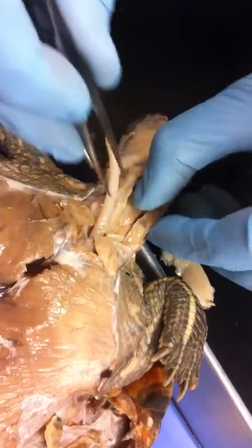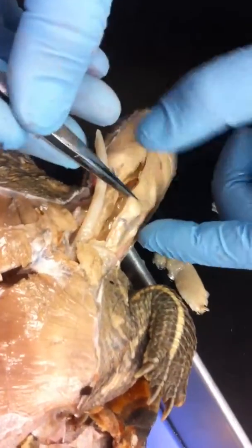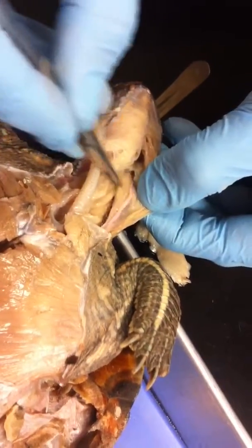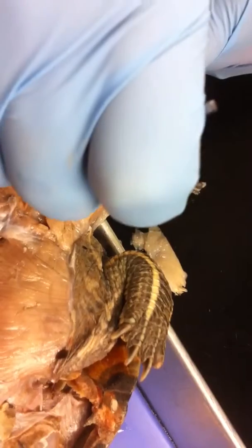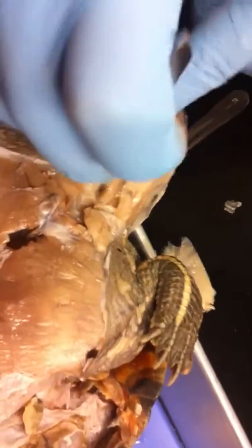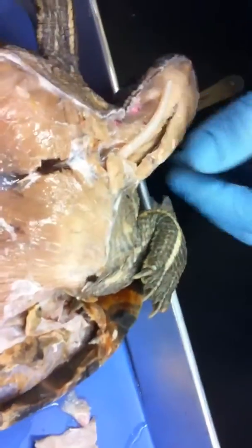That's a wrap of muscles right around the cervical column. Now up in here — you know I showed you the omohyoid and sternomastoid. Any other major muscle group you find down in here, these are all fingers of the retrahens. There's a finger of the retrahens there, and another one there, and they're going to be all the way around — it's connected.